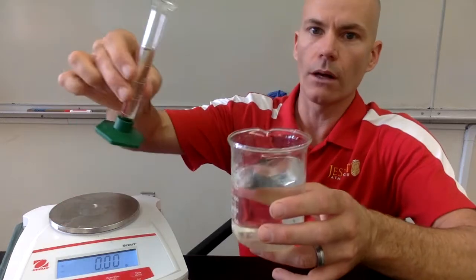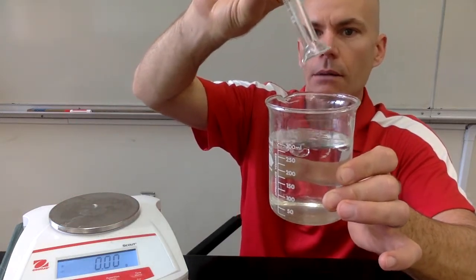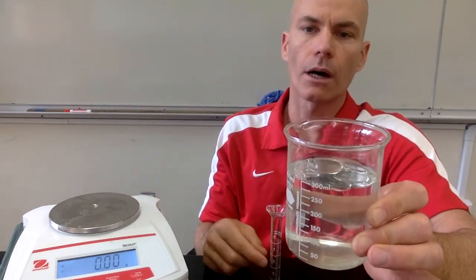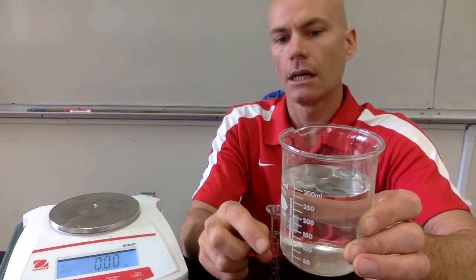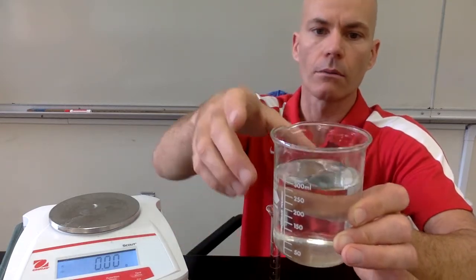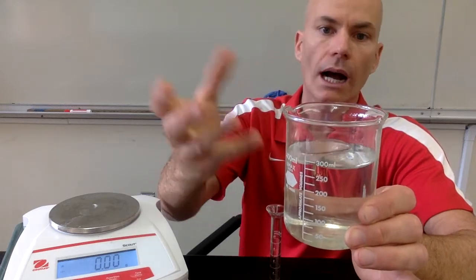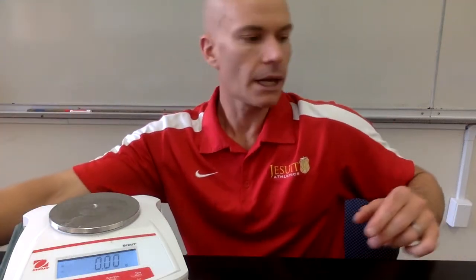And we'll take the oil and we'll pour that into a container of water. And we'll see that the oil is floating on top of the water. So oil floats. You can see these big bubbles up here. Those are the oil. And it's floating on water. We'll try to see if the density of oil can help us predict why it floats on water. All right, we're going to continue with two more substances. So I'll get another graduated cylinder, find its mass.